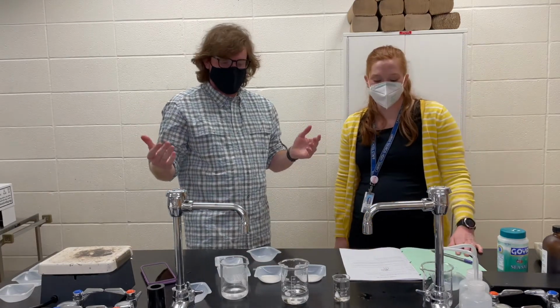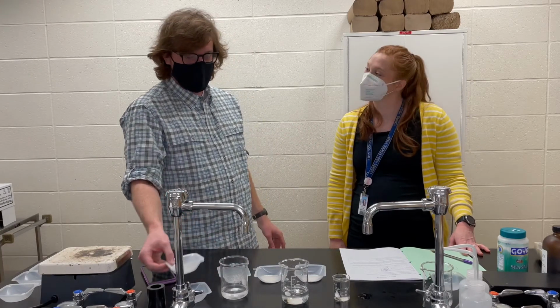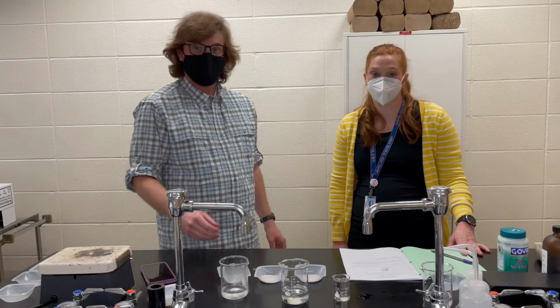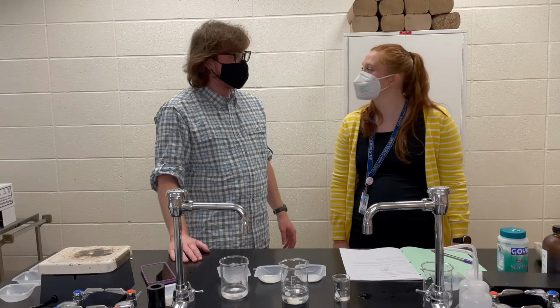Cool. That's part one, temperature and solubility rate. Start working on those claims, evidence, and reasonings based on our data. Get those data points recorded. We'll be back in a second with part two, which we're just about to film. Let's do it.